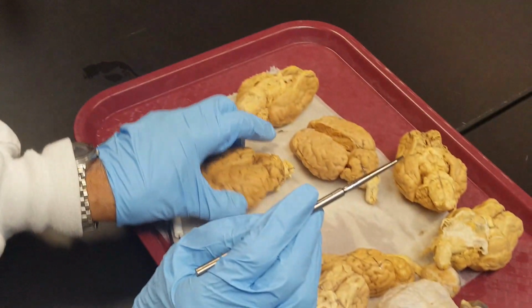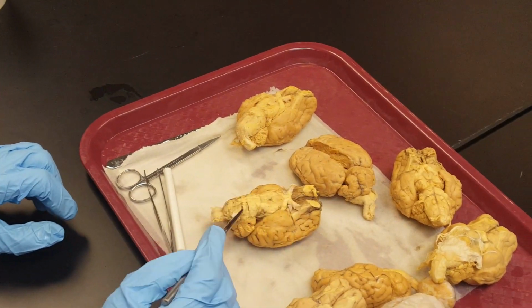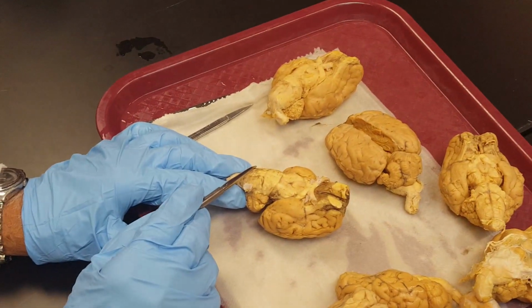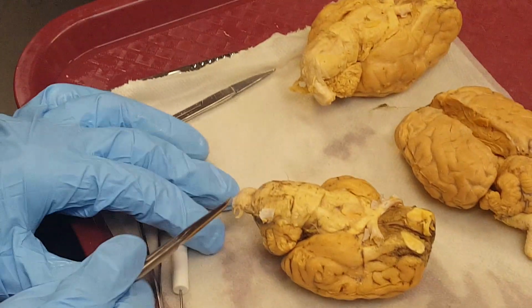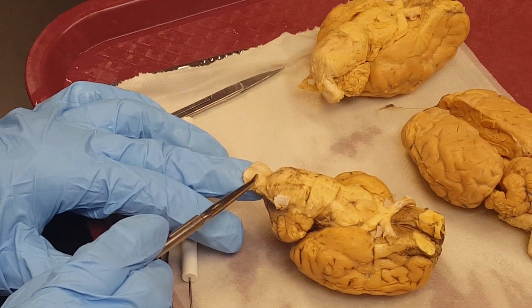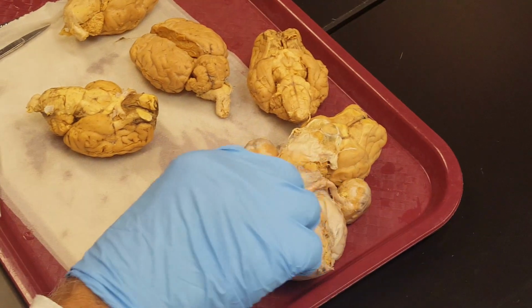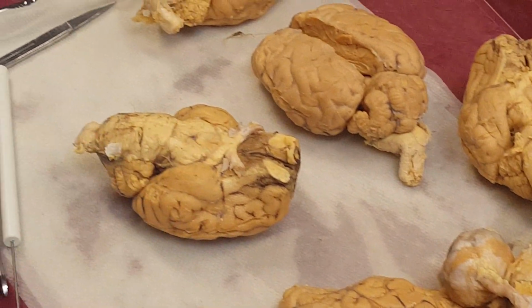All right. Now, on the other side, you can see this portion of the hindbrain called pons, and this is called medulla oblongata. Medulla oblongata, pons, and this is spinal cord. Okay? You see, like you have seen, the two optic nerves, these two. Here you go, optic nerve, optic nerve.